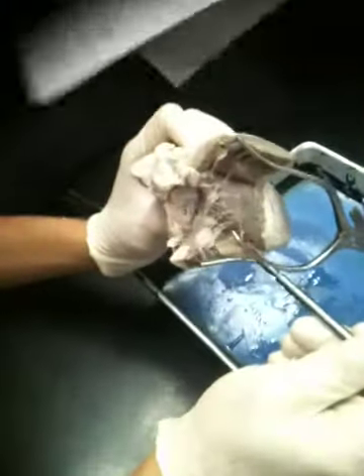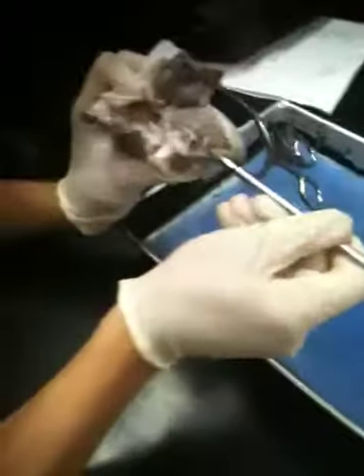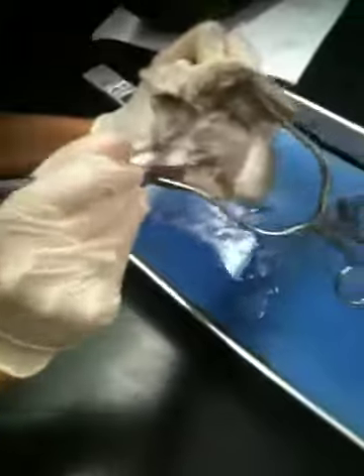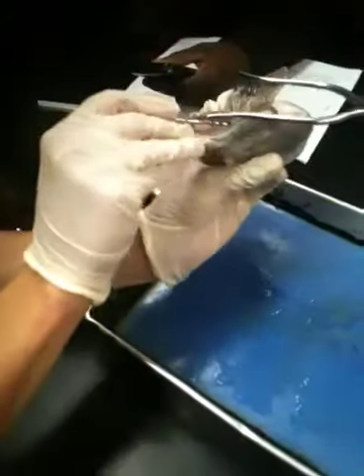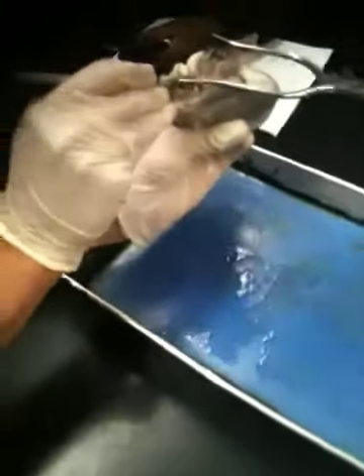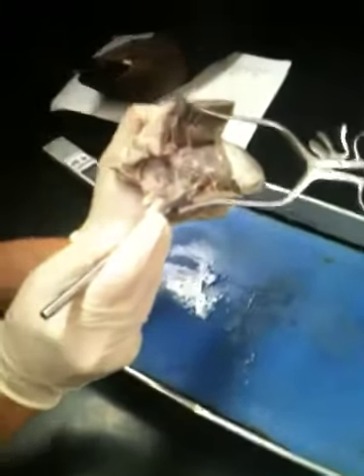Where are the papillary muscles? Just about to do that. What do you think? Notice how a bunch of these chordae tendineae all come down to a bump of muscle that I'm pushing forward with the probe right now. Notice how that one single bump of muscle seems to attach to a whole number of those chordae tendineae right there. So that is a papillary muscle.